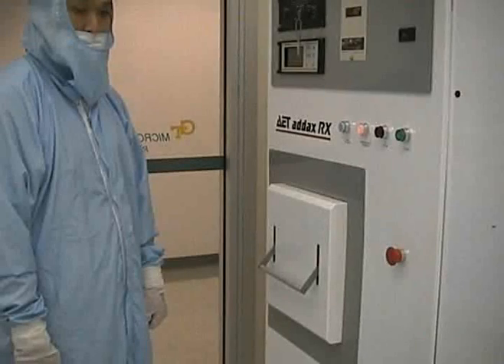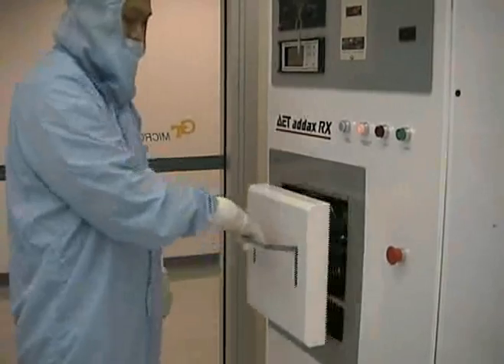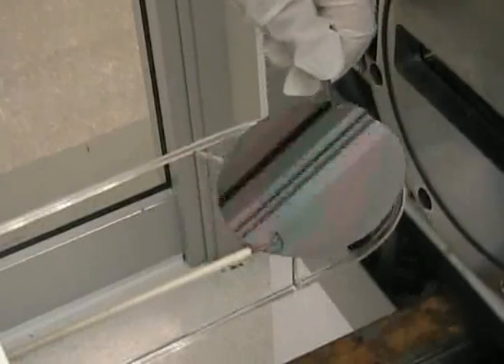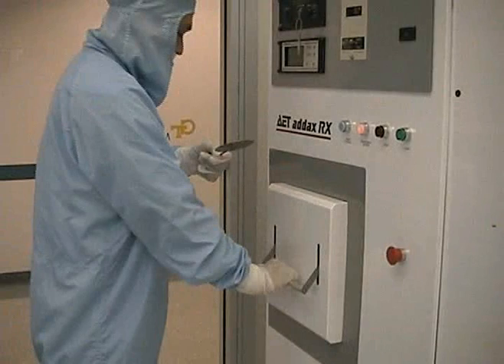We will now go over unloading a sample. If you find the chamber door locked, please contact MIRC staff. Lift the bar on the chamber door and gently pull the door open. Carefully remove your samples using tweezers. Be careful, it may be hot. Lift the bar and carefully close the chamber door. Once the door is closed, push down on the bar to seal the door.